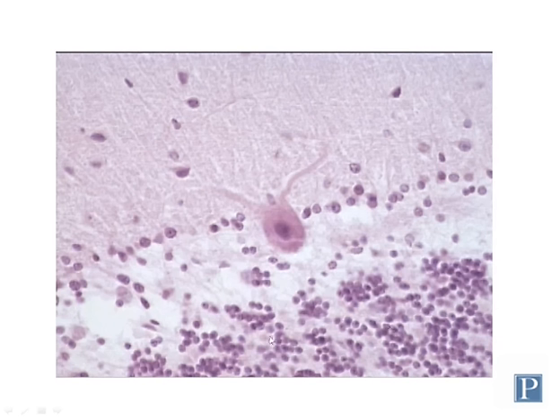So once again, you have the granular layer, here's the Purkinje cell layer, and here's the molecular layer. With this particular slide, you can see a couple of the major dendritic branches extending up to the molecular layer, but as these branches continue to subdivide into smaller branches, they're basically just lost in a tangle of neural tissue.